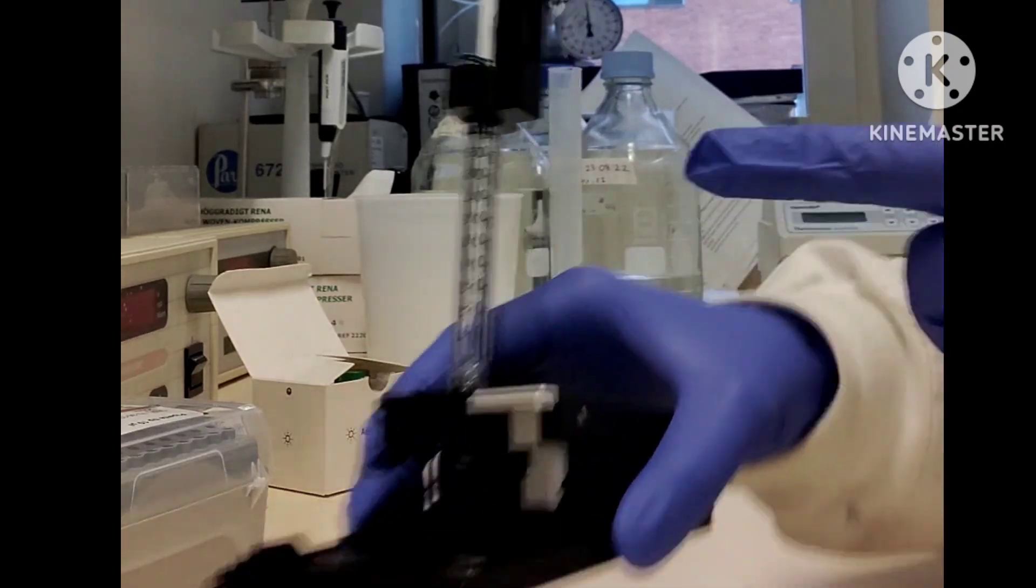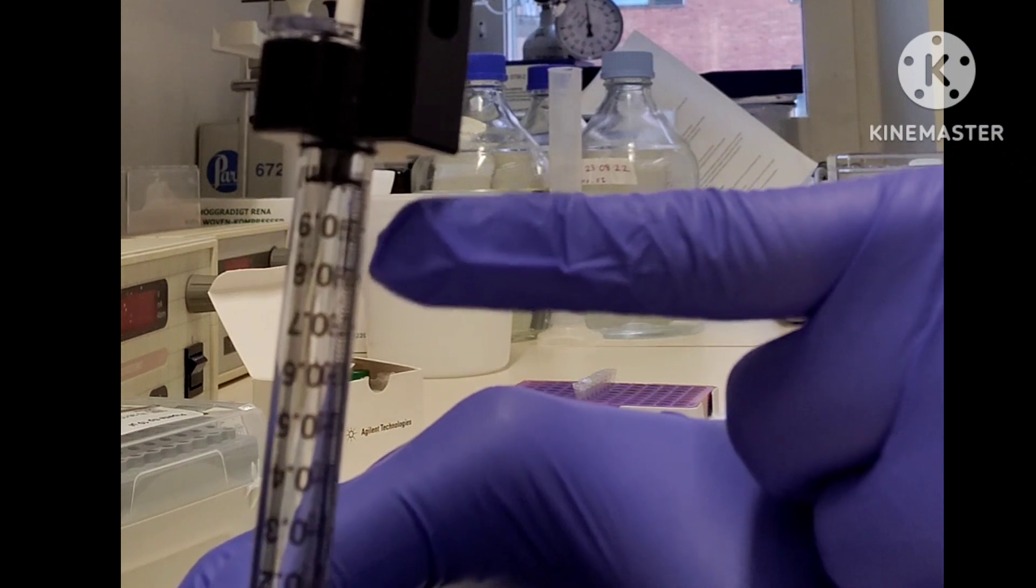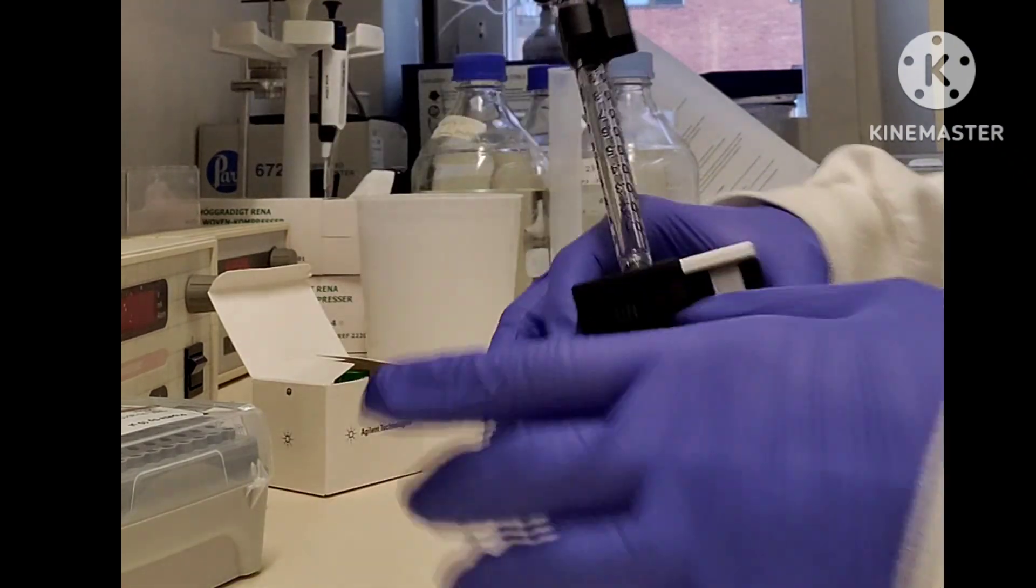Guys, base plate position and syringe clip position will vary according to your assay, so just make sure that the plunger is at 1 ml.